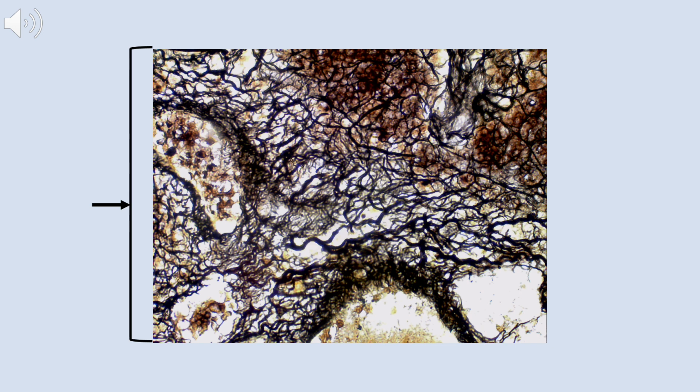That tells me that I'm probably looking at a connective tissue, and specifically reticular tissue. And when I look at the actual fibers themselves, it is reticular, and it looks almost like tree roots with that branching and curvy shape to it. There are a lot of cells in here. You've got to look through the reticulum to see the nuclei, but there are a lot of cells. So this is likely from a lymph node or the spleen or a tonsil, somewhere that has that lymphatic tissue. So the primary tissue type is connective tissue, specifically reticular connective tissue.